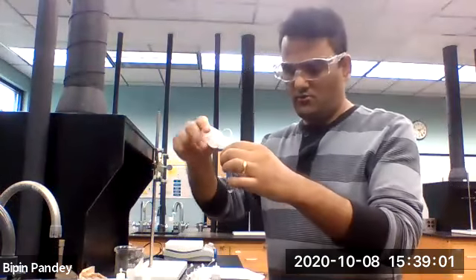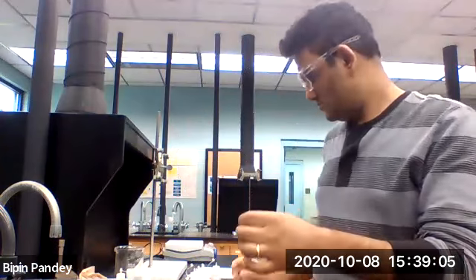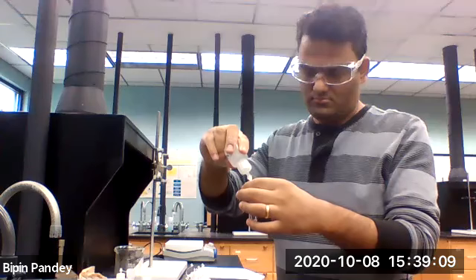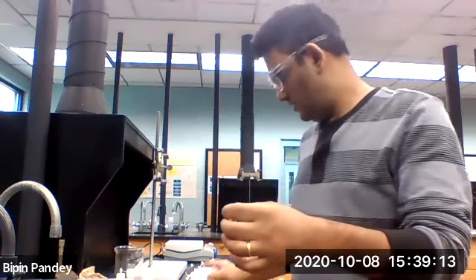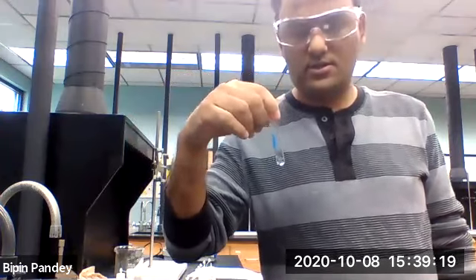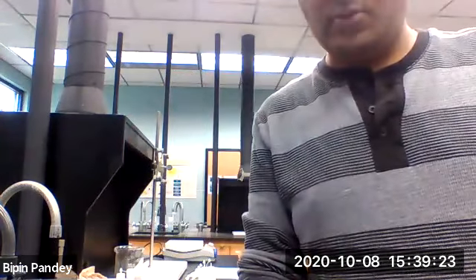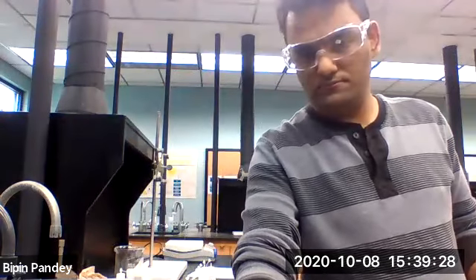The last one, aluminum and sulfate. Aluminum and sulfate gave no reaction. Solution stays clear. So those are the reactions for aluminum, and we have 2 more to go.